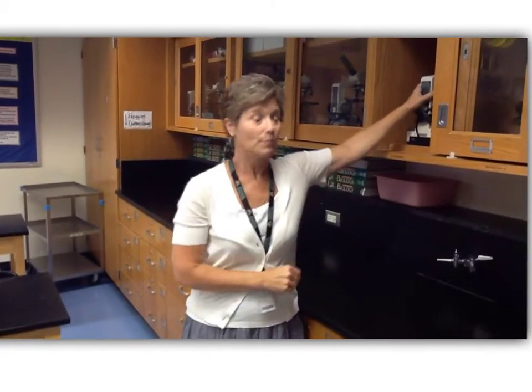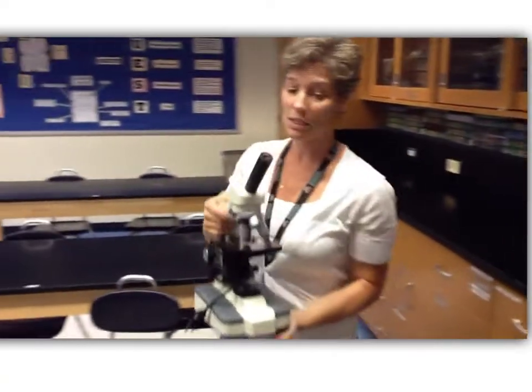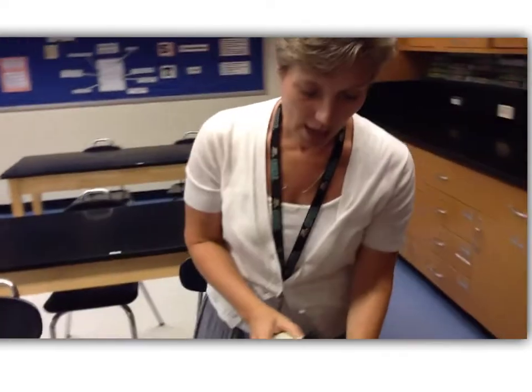To start with the microscope, you're going to pick up the microscope by holding on to the arm and the base, bring it back to your seat, and put it down on the desk.